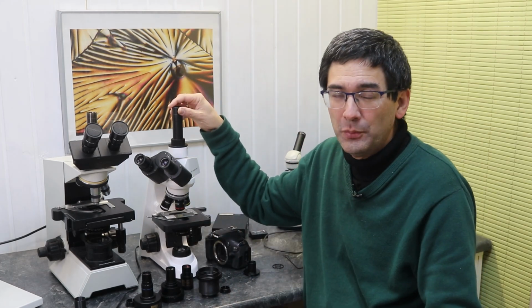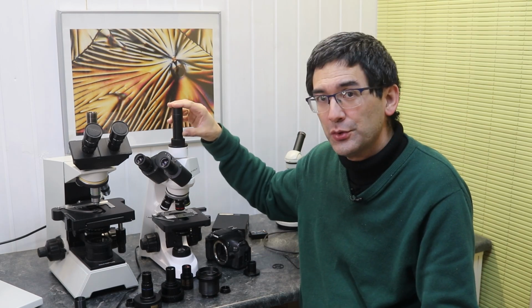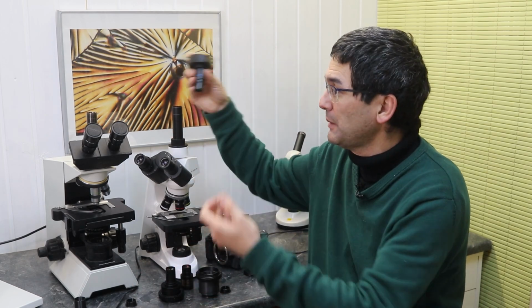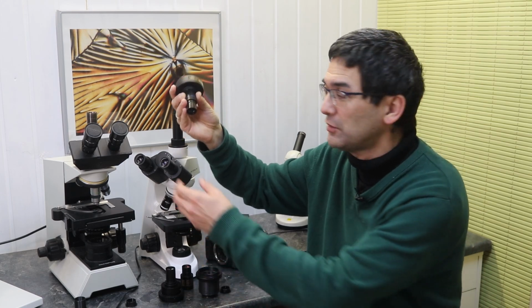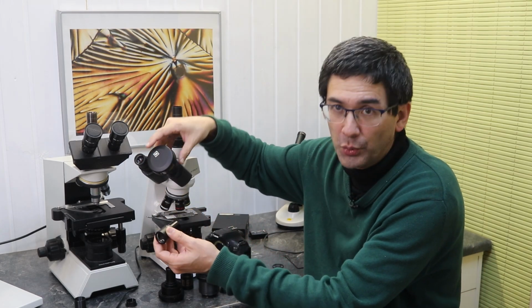Now, many microscopes that are available these days have a so-called phototube, and those phototubes are very convenient because they allow you to connect a USB microscope camera simply by putting it into the phototube, just like this. These are so-called eyepiece cameras, and this means that you can also put them in here instead of an eyepiece. It also works.